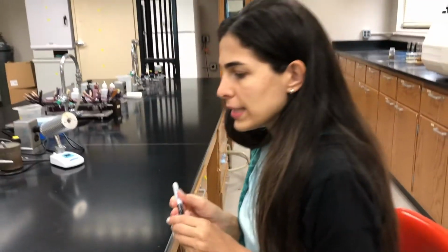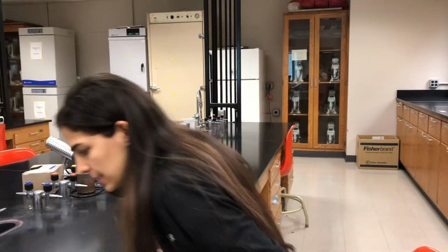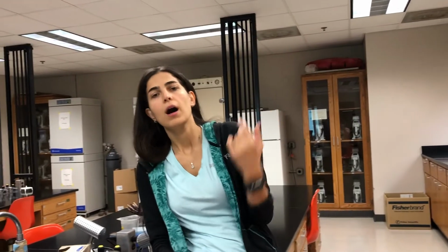So what is the conclusion from these experiments? It means that microbes are everywhere. And you can see that different colonies grow on a plate. But the growth of microbes is dependent on some things. First is the temperature. Sometimes bacteria grow at 28 degrees, sometimes they grow at 38 degrees, and sometimes even up to 60 degrees.